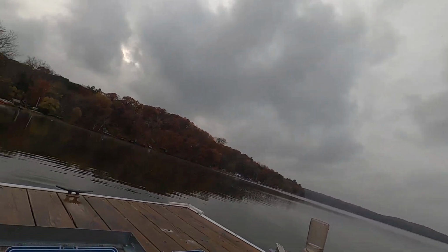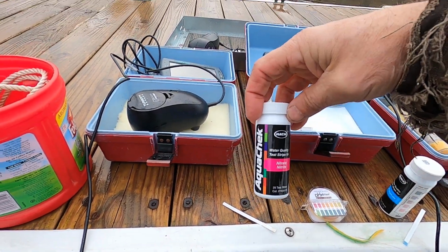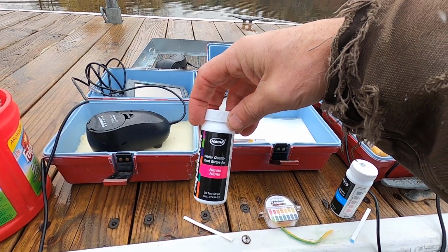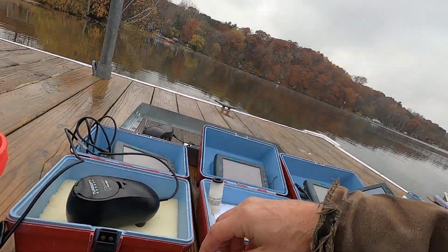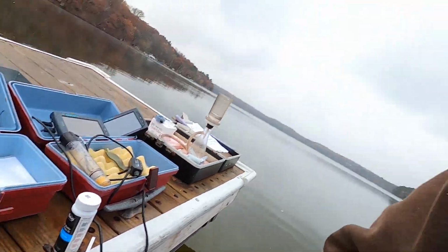So we can also test nitrate, and you'll recall that nitrates are part of what we basically call nutrient, and there should not be a strong nitrate test. And so our little strip here says, if we match the colors here, it shows that there are 0 nitrates in the water, and that might be a little deceiving.